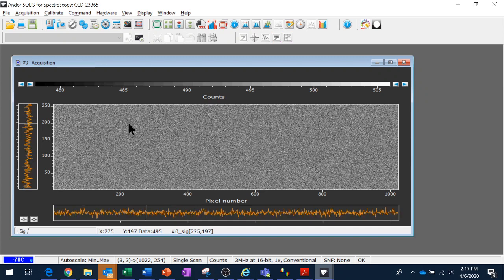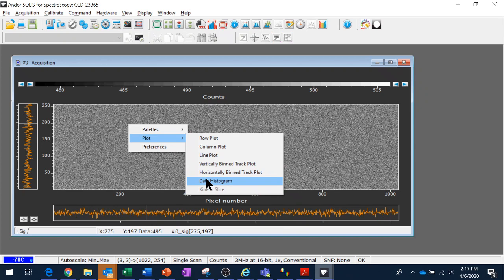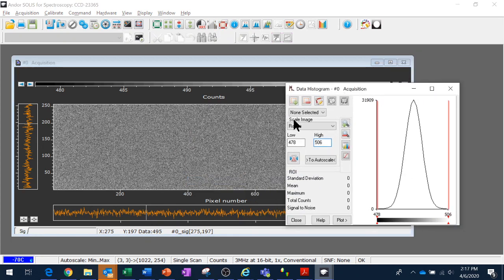I'll actually pop up a histogram so you can see what I'm talking about a little bit more clearly. You can see I have just about 490 mean counts, even though I would hope to have zero. So is this dark current? Is this light sneaking through?